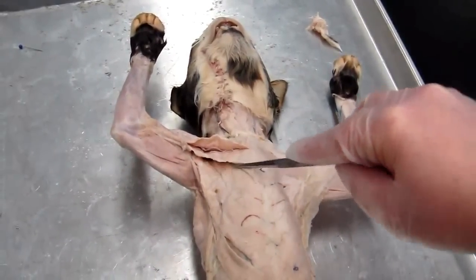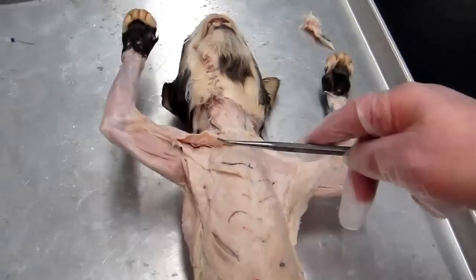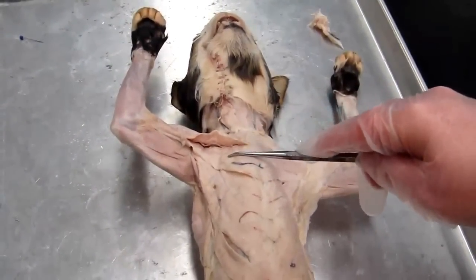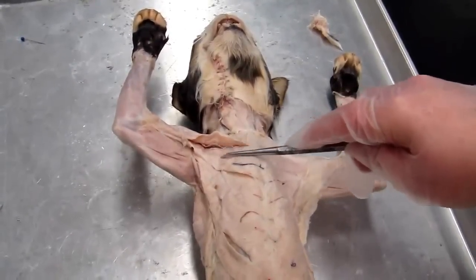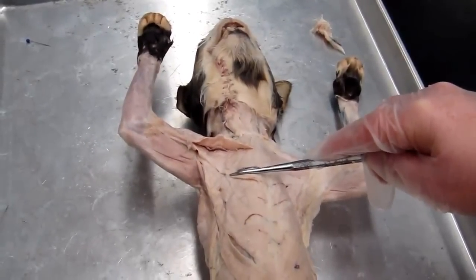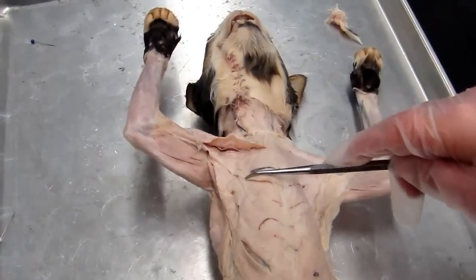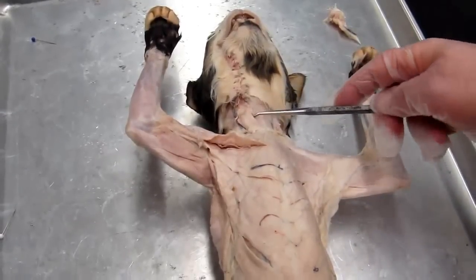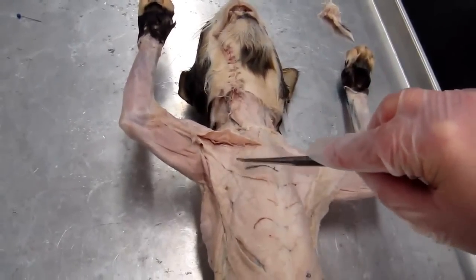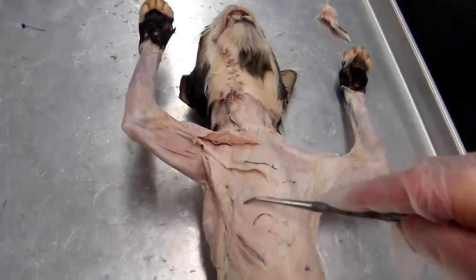Okay, pectoralis major action I didn't mention. This is a very important muscle because it's our prime mover or agonist for flexion at the shoulder. And if you remember from lab, being a prime mover or agonist means that you're a muscle that's primarily responsible for that particular movement. Okay, it also assists with adduction and medial rotation at the shoulder. Okay, so that again is the sternocleidomastoid muscle, the pectoralis major, I'll lift up here, and the pectoralis minor.